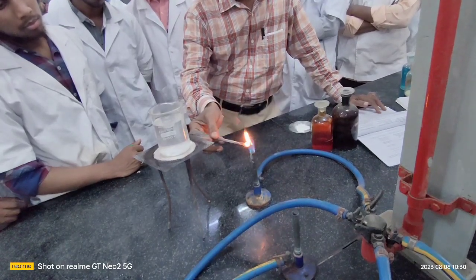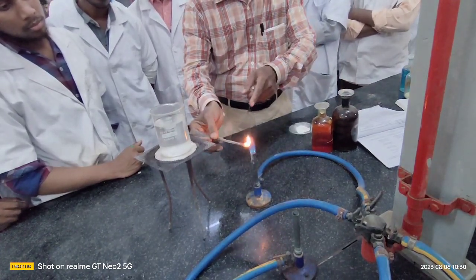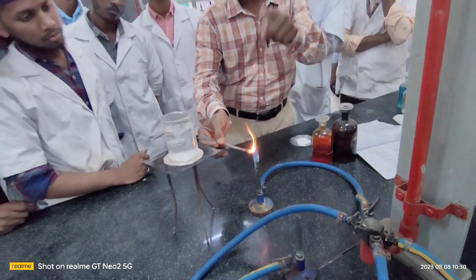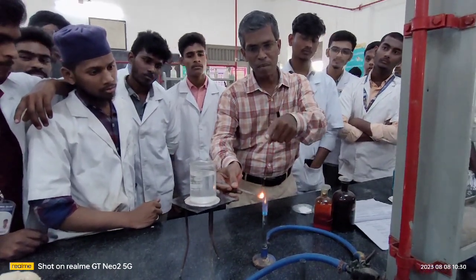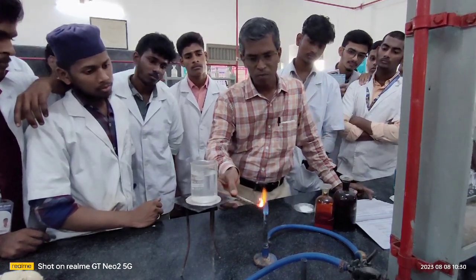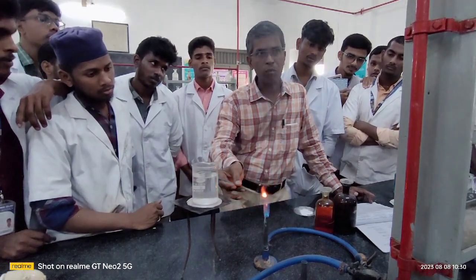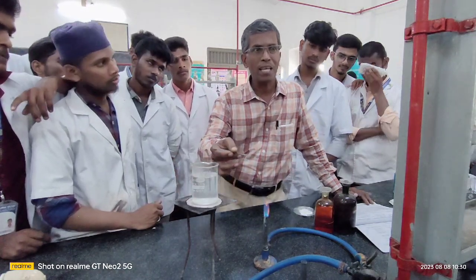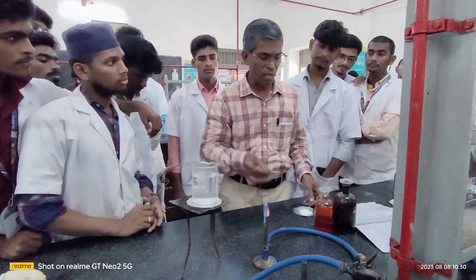The compound catches fire and immediately starts burning with a lot of luminous flame or sooty flame. See the smoke that is coming out of this organic compound. This is your luminous flame or sooty flame with a lot of carbon coming out of this compound. Once you get this result, this confirms the presence of aromatic in the given compound. As a result, you are confirming that the given compound is aromatic. Otherwise, the compound is aliphatic. Right? I'll show you again.